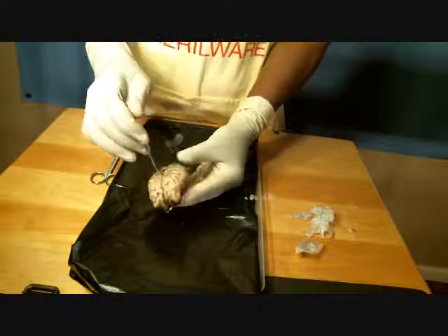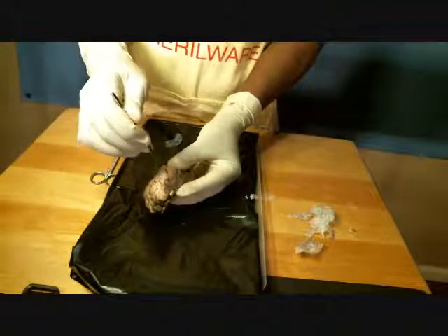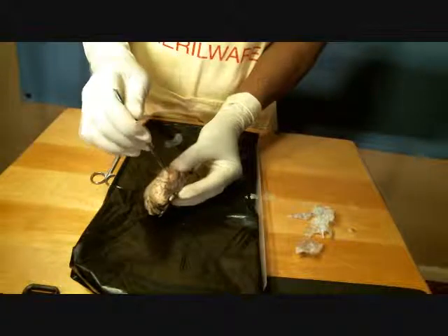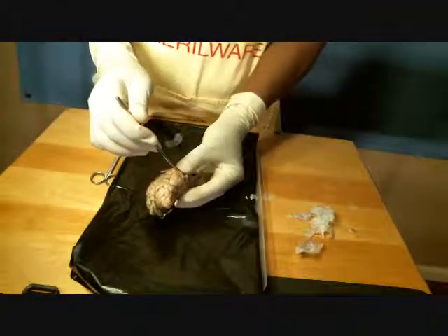Okay, I was looking for a lateral sulcus that was as easily defined, and to be perfectly honest, I didn't see exactly what I was looking for, so obviously I didn't know exactly what I was looking for in defining that lateral sulcus.